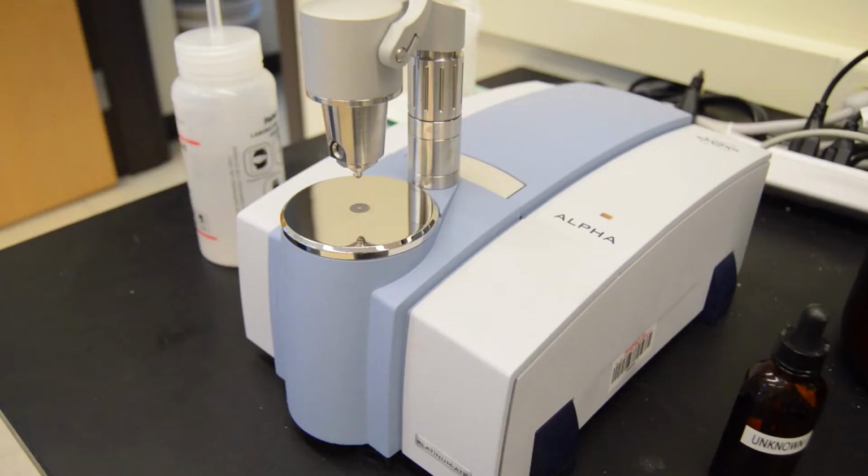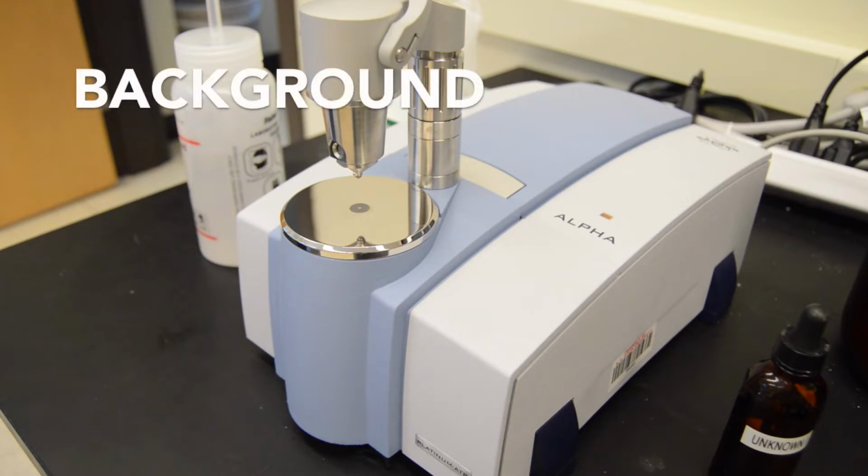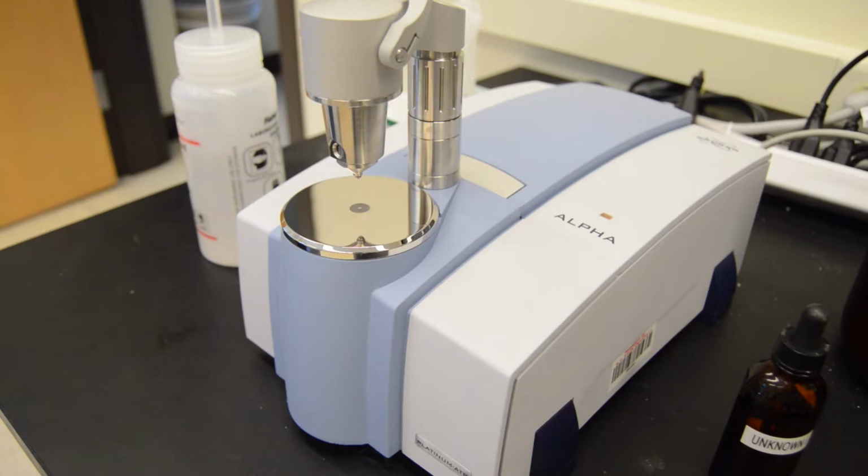This video demonstrates the use of infrared spectroscopy, also known as IR. IR is used to assist in identifying functional groups in organic molecules. Before you can run an IR spectrum, a background must be run. The background takes an IR signature for the molecules present in the atmosphere.